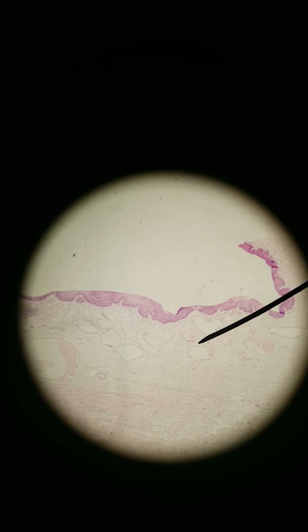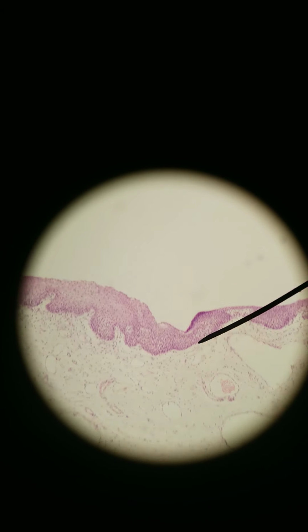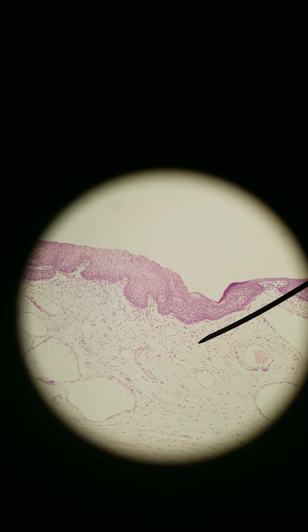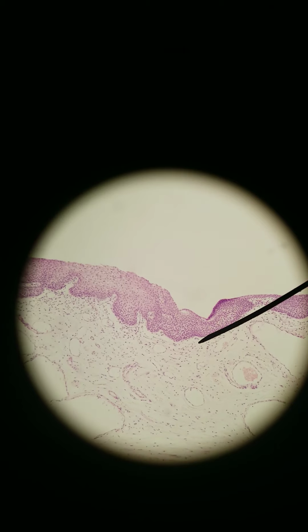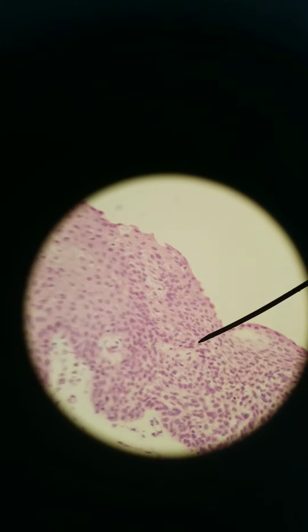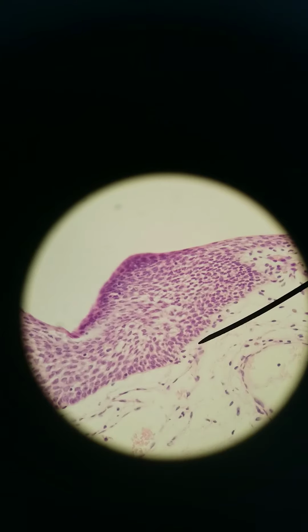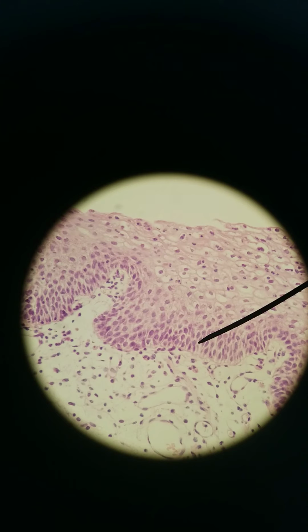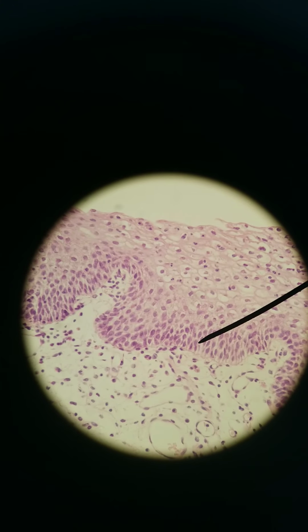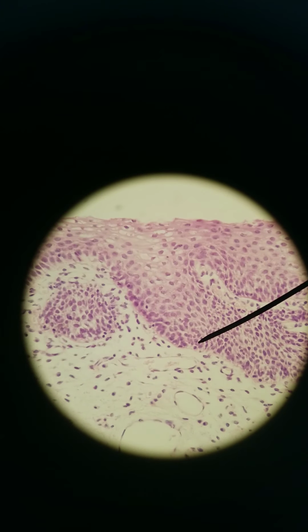Okay, so let's take a closer look. We're at 40x. 100x. Looks very stratified, but we need to look closer to see that it's transitional. This is all that areolar connective tissue. There. Look at how irregular the layers are. No real order to them. That's transitional. If it were stratified squamous, we would see, like these down here look columnar. Some look cuboidal, some look squamous. It's just kind of a mix.